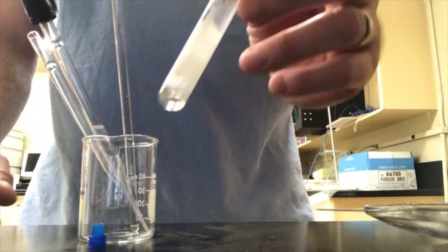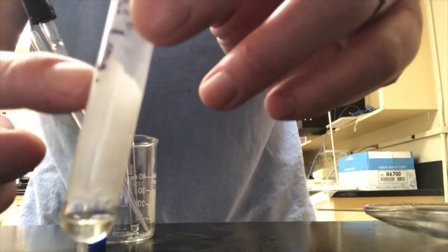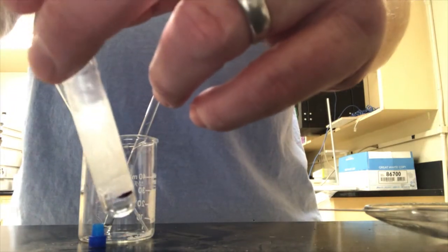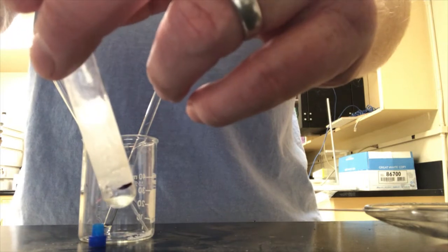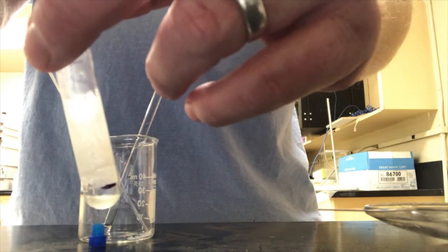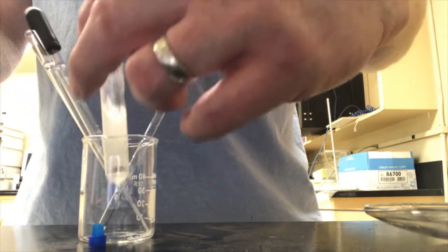Okay, I have the sample evaporated down below that 0.5 centimeter line. That's good. And I got a lot of solid here. I'm going to try to pipette some of this up and then put it down the side, see if it'll help. Doesn't seem to do much. It looks like this is really oversaturated right now, which is what I wanted. What I'll try is to help dissolve it with the expensive stuff, the deuterated DMSO, good stuff.